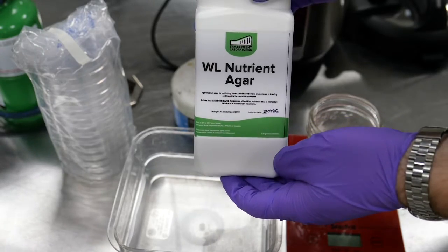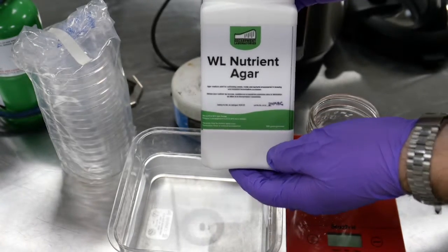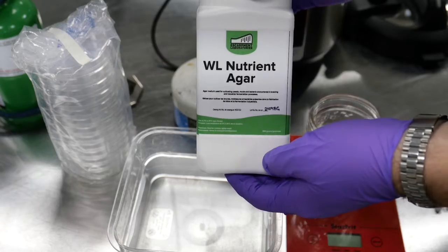You can make your own agar plates in your brewery using really common low-cost equipment.